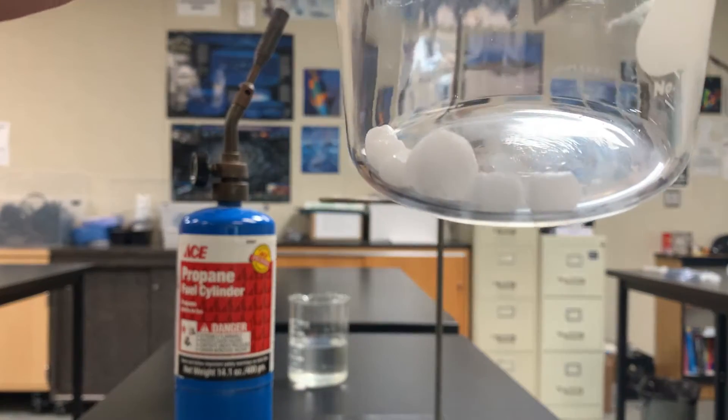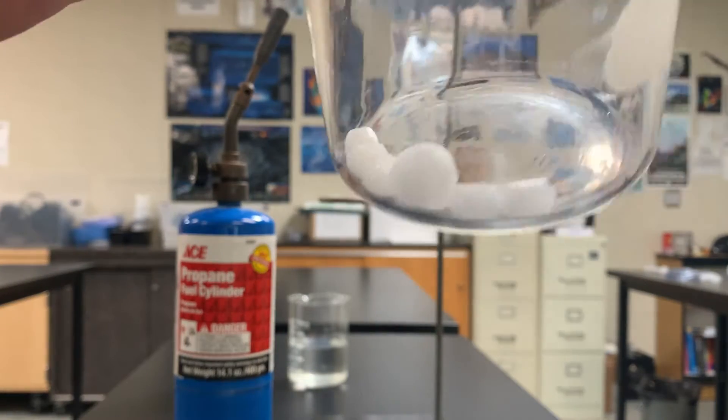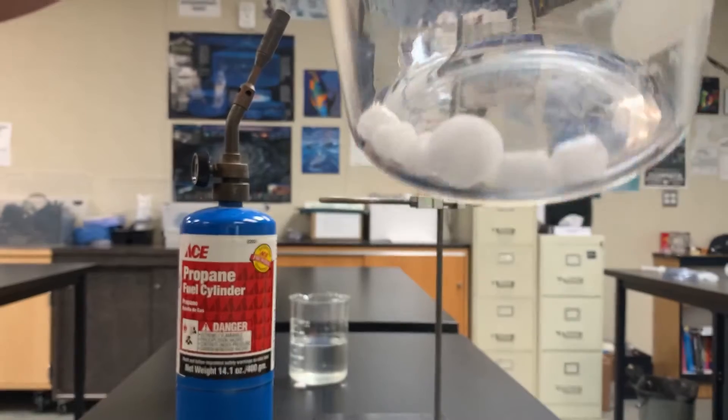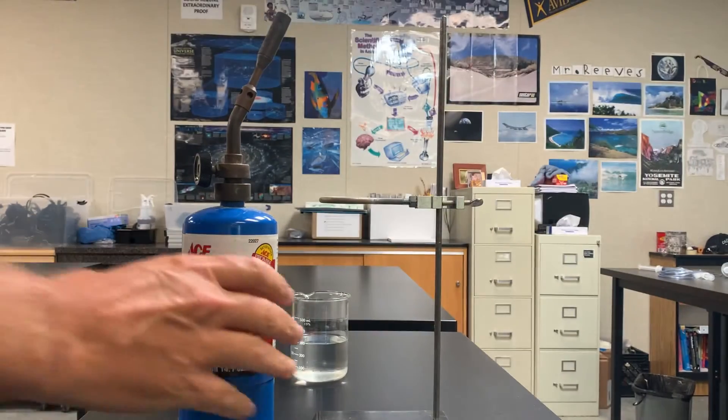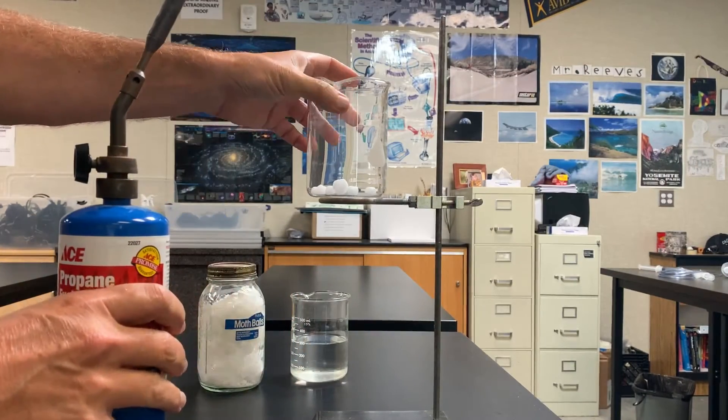You can see it's a white solid. It's really stinky. It has a strong odor. So it's coming off into a gas right away. Now what I'm going to do is I'm going to set that up on this ring stand up here.